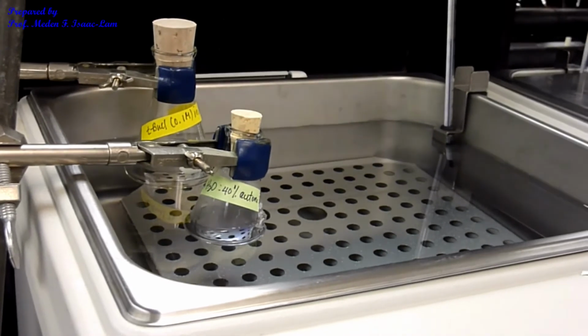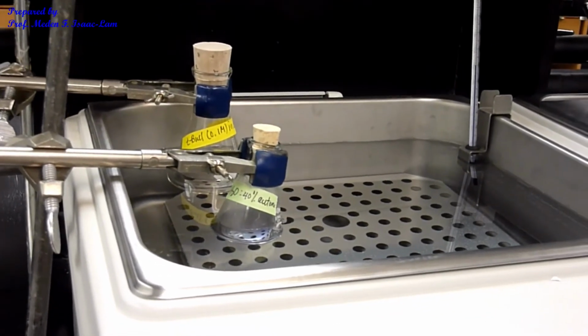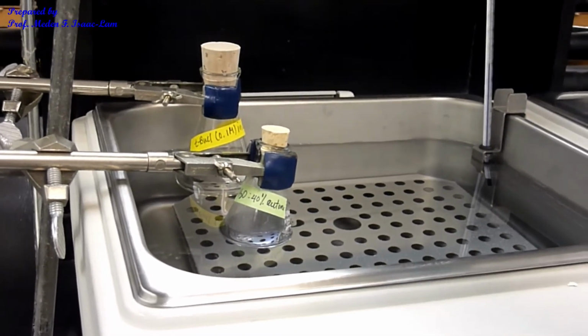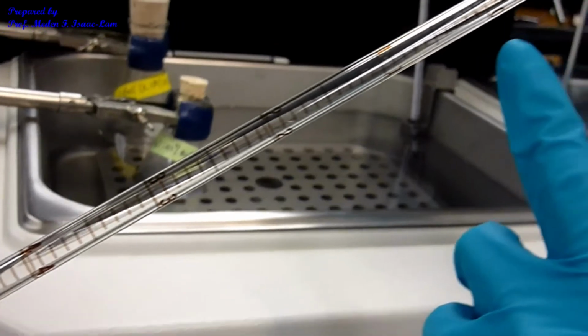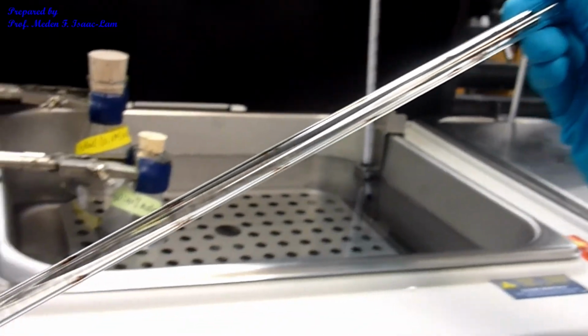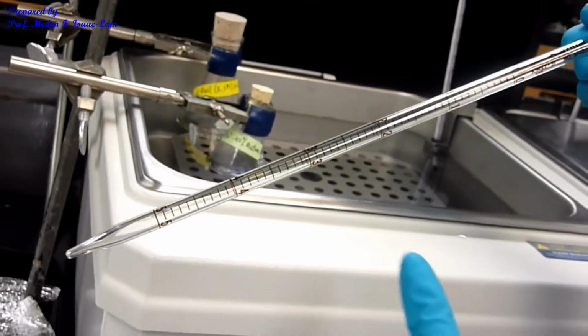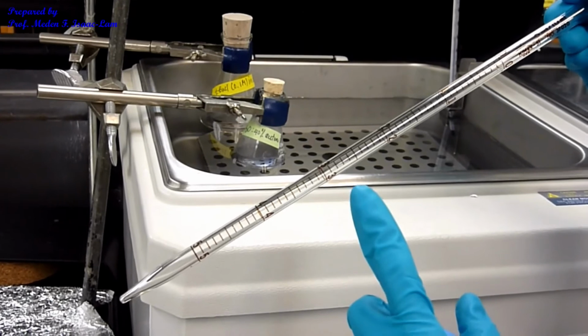So I'm going to use a straight pipette. I'm gonna pipette up to 1 and then deliver up to 5, okay? But I'm also going to time it when I delivered already like 2 ml, okay?